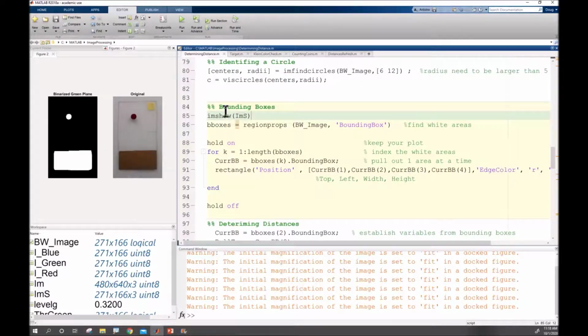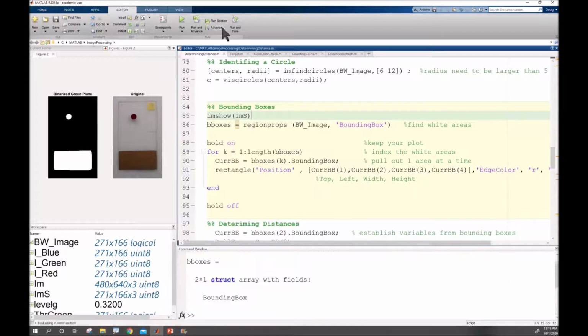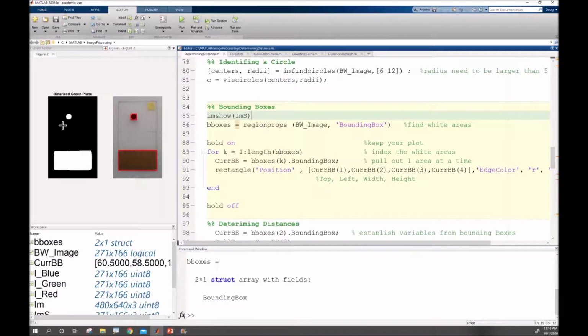What I'm going to have to use is a bounding box, so I'm going to show my image. I'm going to go in and find some regional properties of that with bounding boxes, and really what it's doing is looking for all the full white areas. I can run that section, and it's saying, hey, here's one and here's one. Then this code down here is taking those individually.